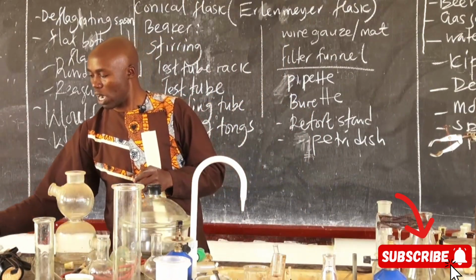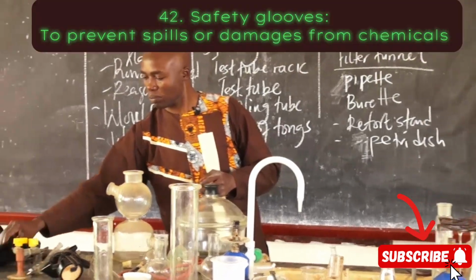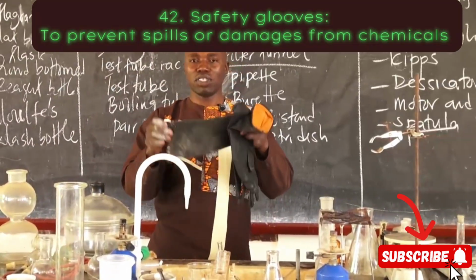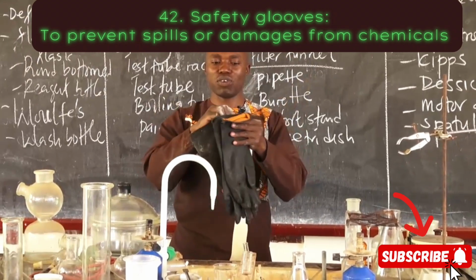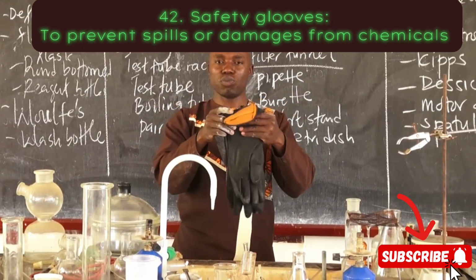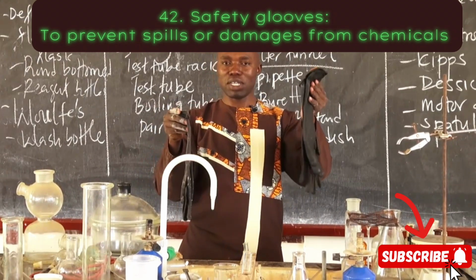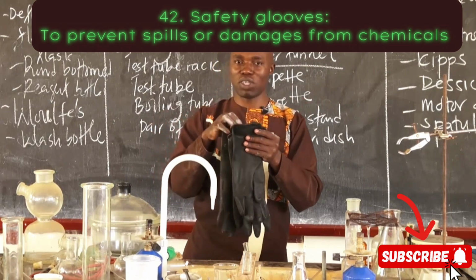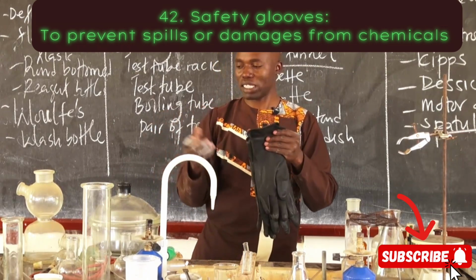Then we also have around here what we call the gloves, safety gloves. They are normally used to prevent damages from chemicals such as acids, so you wear them to prevent damages or spills from acids.